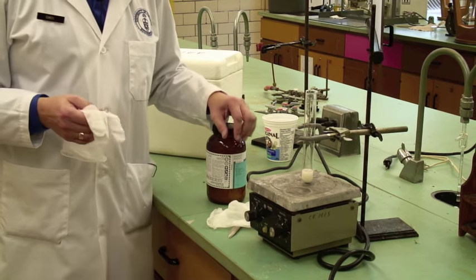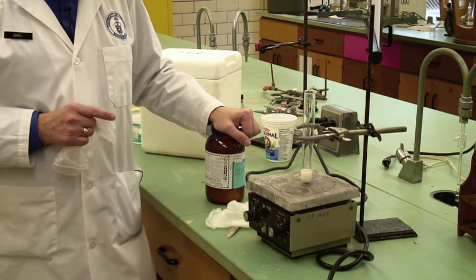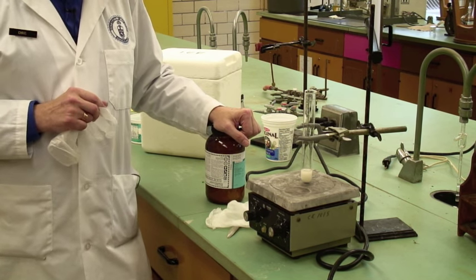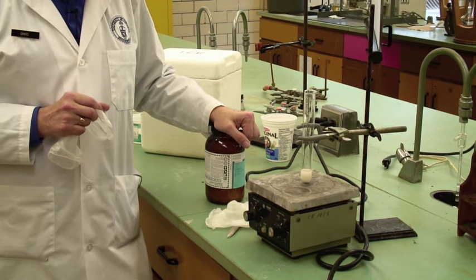This video is to show you how to operate the equipment and safety precautions that you will need for liquid-liquid phase equilibrium.